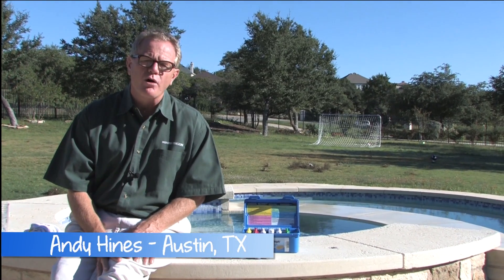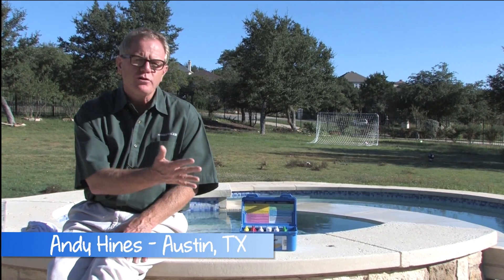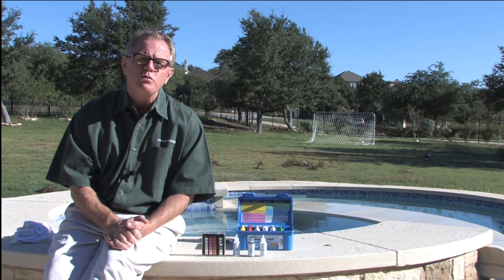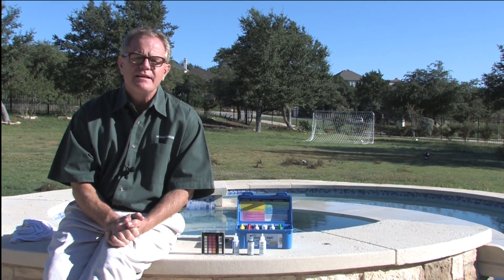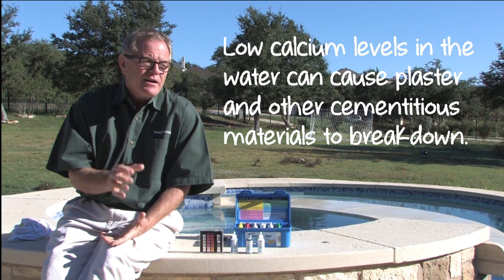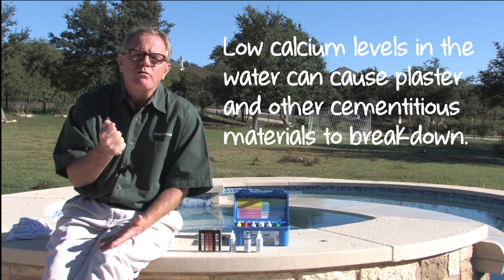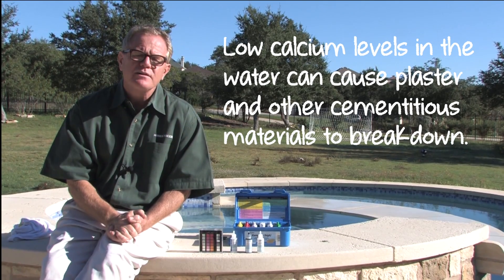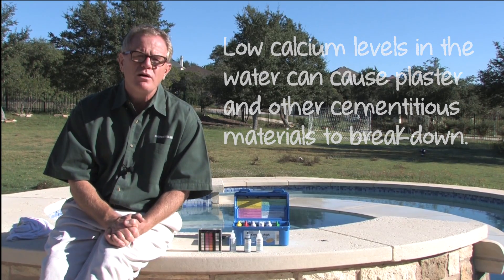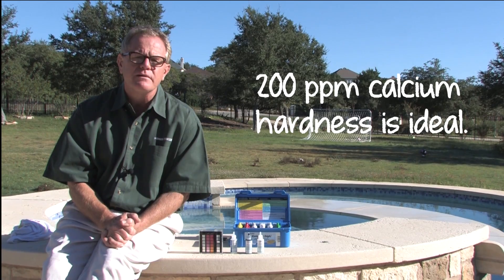Next we'll be testing calcium hardness. Why do we want calcium in the water? All the surfaces, whether it's plaster or some of the newer exposed aggregate surfaces in pools, have a lot of cement in there, so they're considered cementitious surfaces. Water can be very aggressive and take that cement out. If we supply enough calcium to the water, it is much less aggressive. We want about 200 parts per million — two to four hundred parts is certainly acceptable.